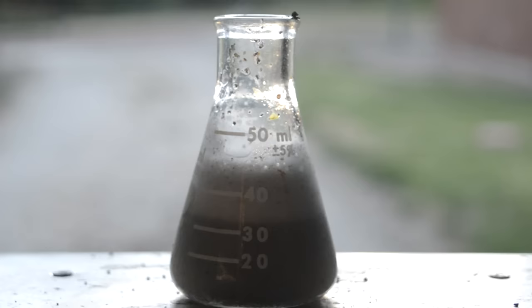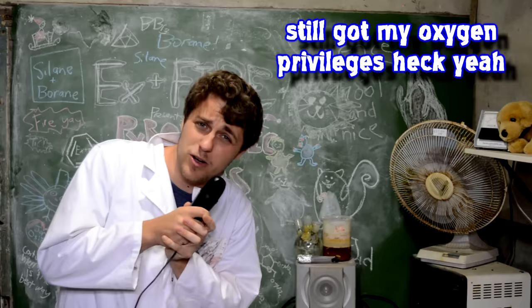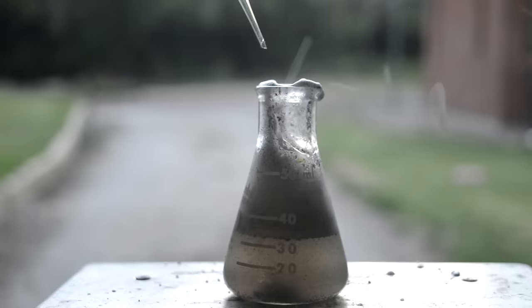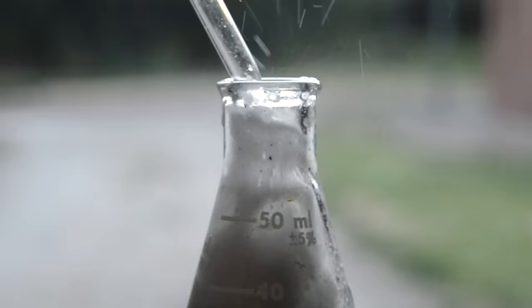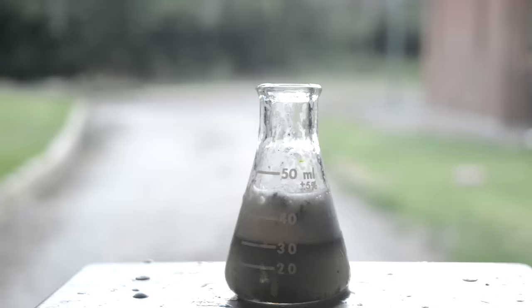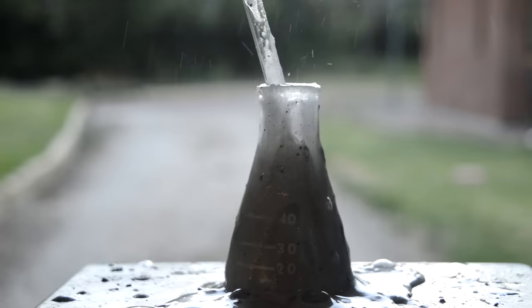Now we can add our magnesium silicide - it'll react with the hydrochloric acid and bubbles of silane will hopefully get caught in the foam. It wasn't really doing anything, and for some reason no one's taken away my oxygen cylinder, so let's pump some oxygen in. This still kind of sucks, I was hoping for an explosion. I'll just keep trying until I get an explosion I suppose. I probably shouldn't have done this as much as I had - I just forgot that it was acid and I was just spraying acid droplets everywhere, all over the metal of the stand and the camera and everywhere.